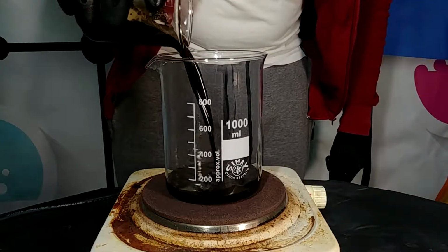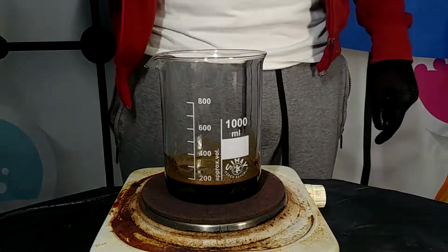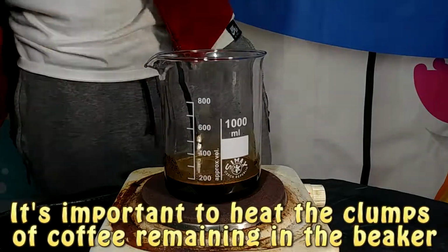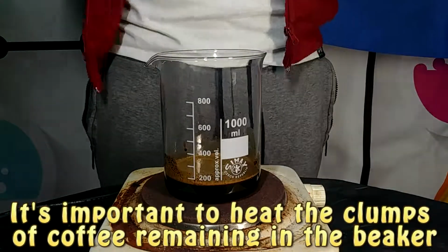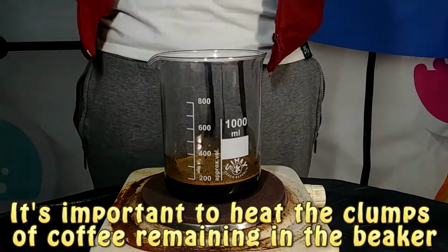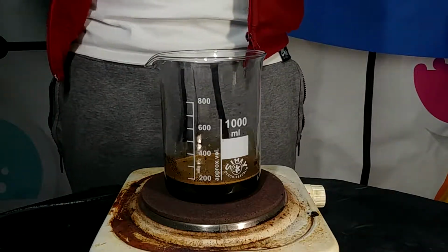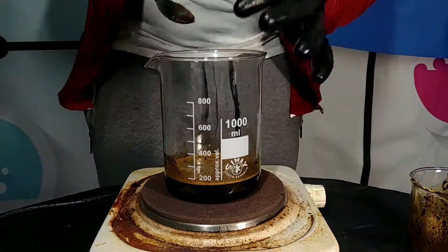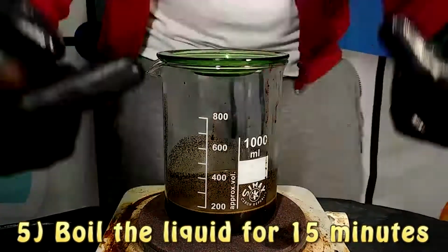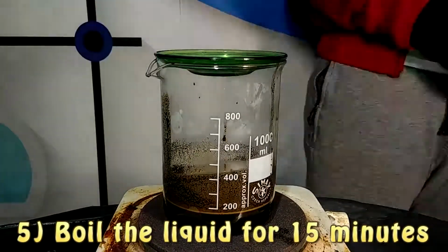So we do this because when we add sodium carbonate to our solution, we are able to solubilize more caffeine from it, and also this is why we heat up the solution, because with heat the solubility of caffeine increases, and that's why we use both sodium carbonate and, as we said, heat, in order to solubilize all we can from coffee.